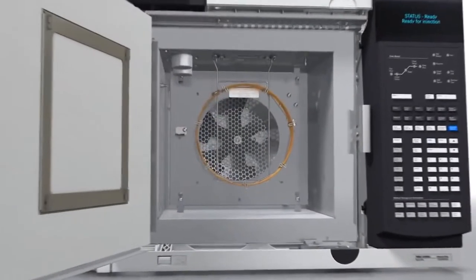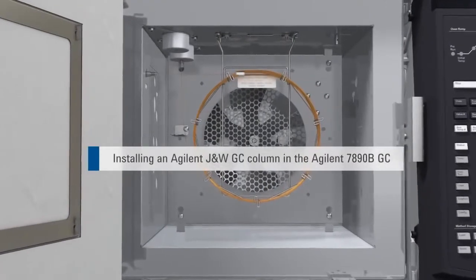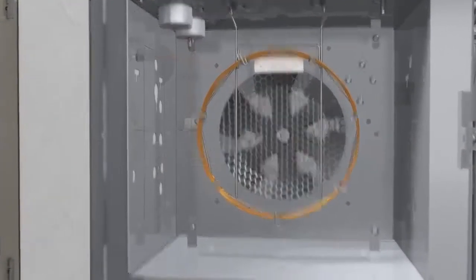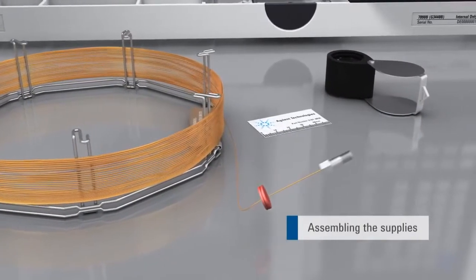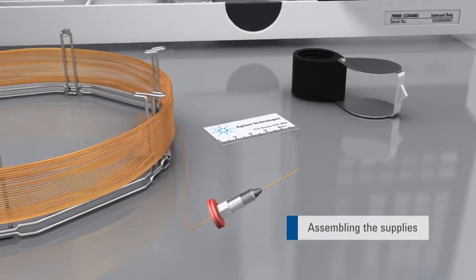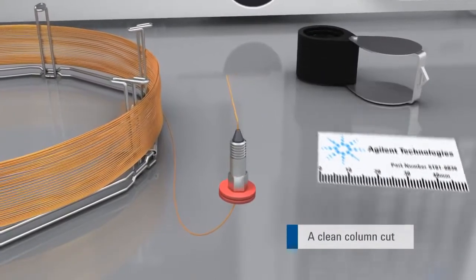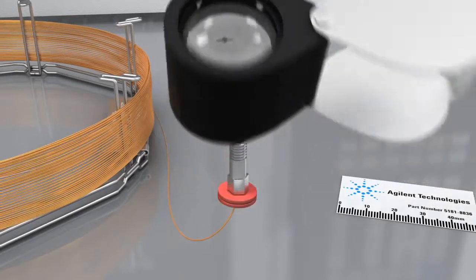The correct tools and supplies make proper GC column installation easier and ensure consistent, robust, leak-free connections and reliable results. Thread the column through an inlet septum and then through a column nut. Choose an appropriate column ferrule and thread column through it. Make a fresh cut. Visually inspect that the end is free of chips, burrs, or uneven areas.